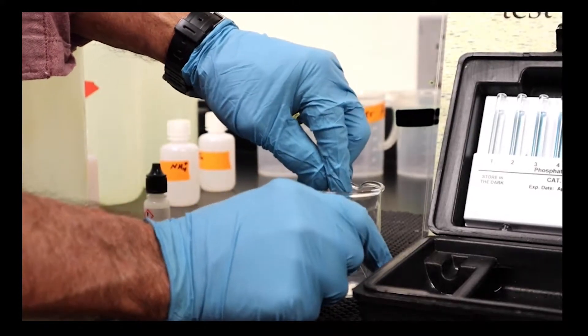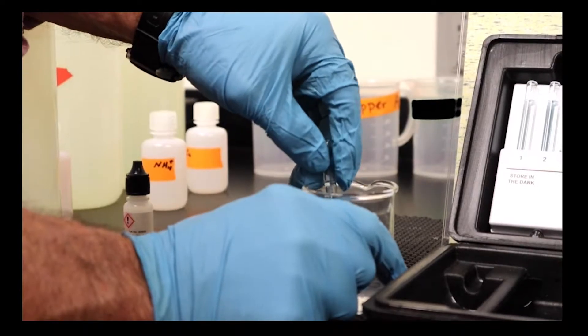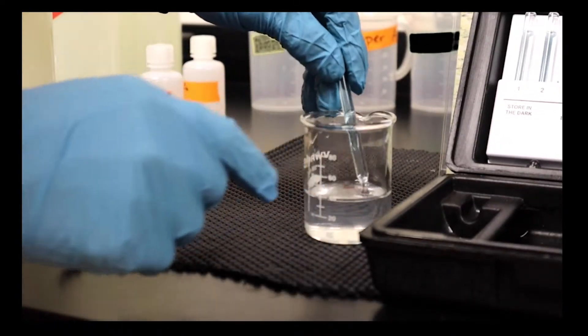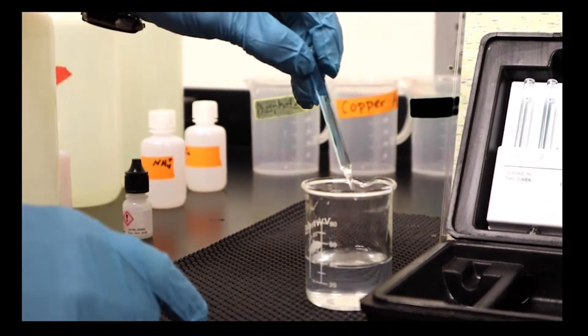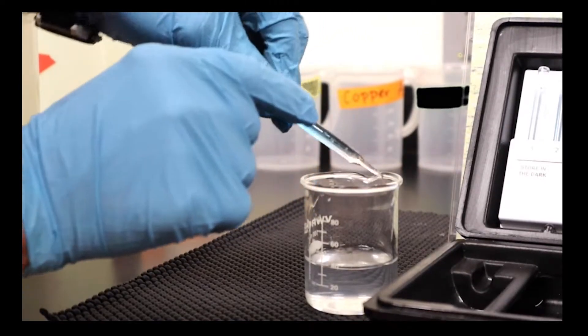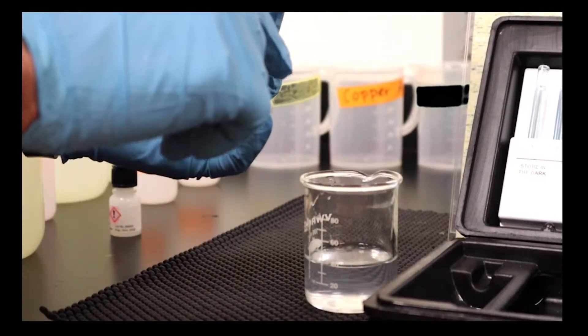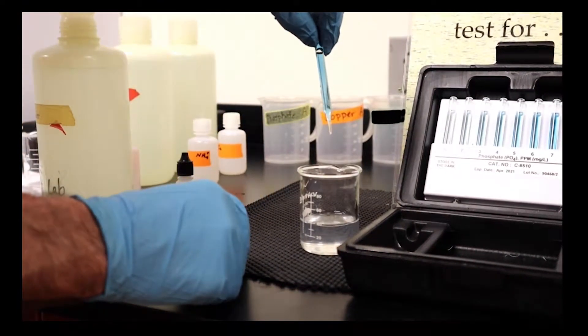So now we break the ampule, we let the water suck in, and you can see what's happened—we've got now an ampule full of sample and it's starting to turn color. We'll try to make sure we've mixed it well, there's one little bubble in there.